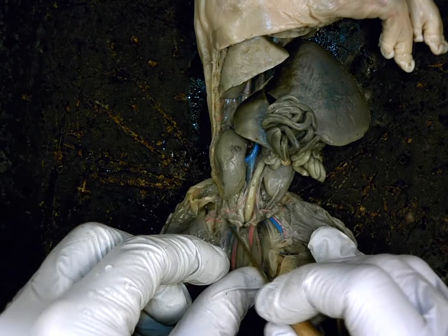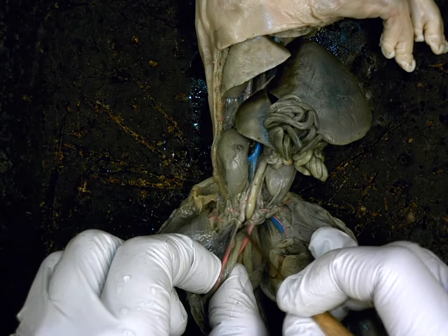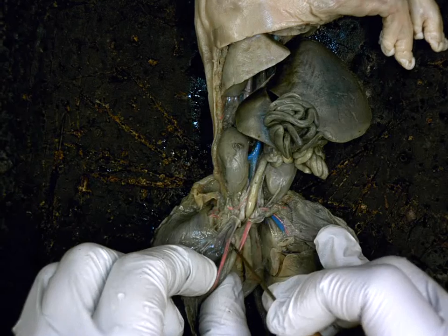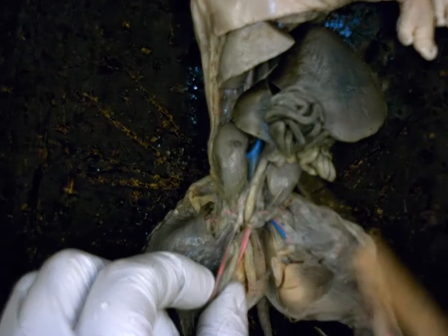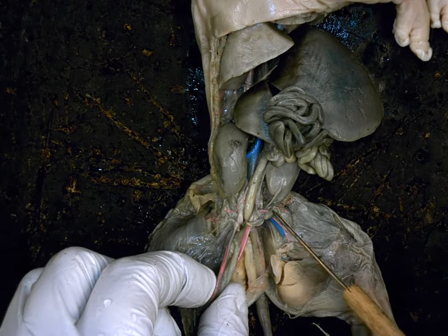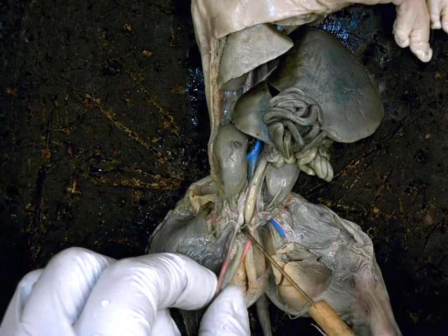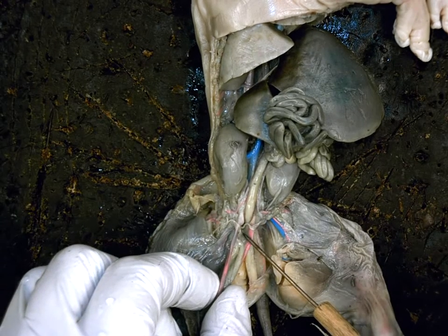Now, from these tiny coiled up tubes that are still kind of near the ovary, you're going to see what looks like little white tubes that are coming to the middle, and they join right underneath the bladder. Okay, they come down and unite underneath the bladder. Does everyone see those? Let me zoom in here. Ovary, coiled up oviduct, and these tubes coming down are actually, at this point, part of the top of the uterus. They're called the uterine horns.